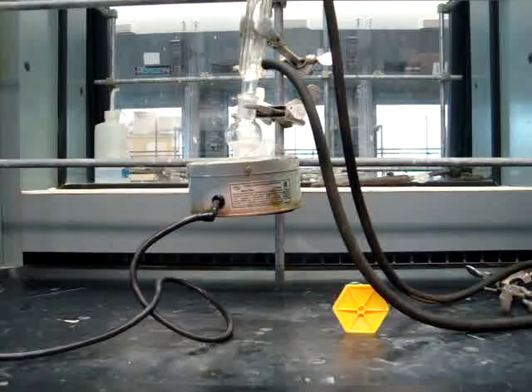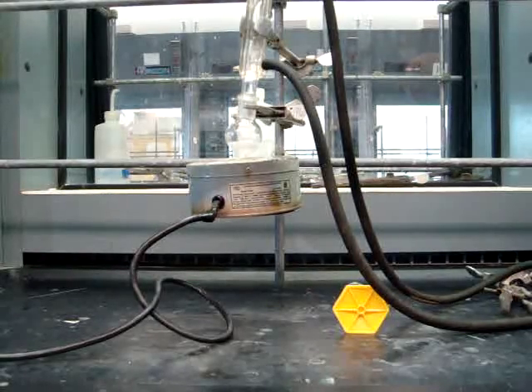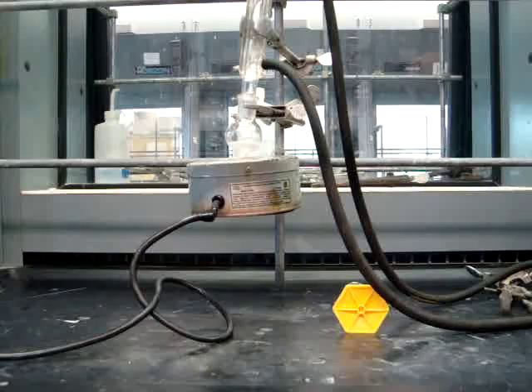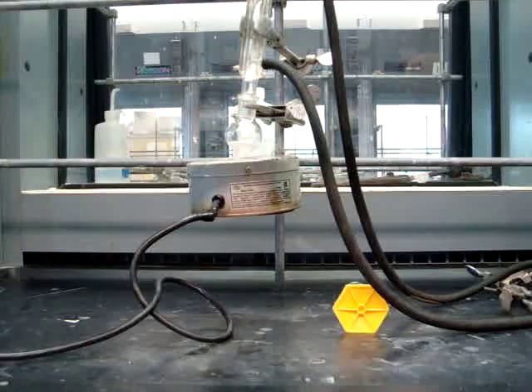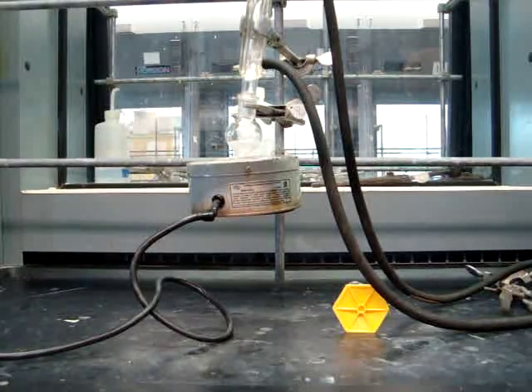In portions, make sure you cautiously add 0.48g of sodium borohydride to the solution. When all the sodium borohydride is added, you will reflux at the boiling point of methanol, which is about 70 to 80 degrees Celsius, in a sand bath for 15 minutes.